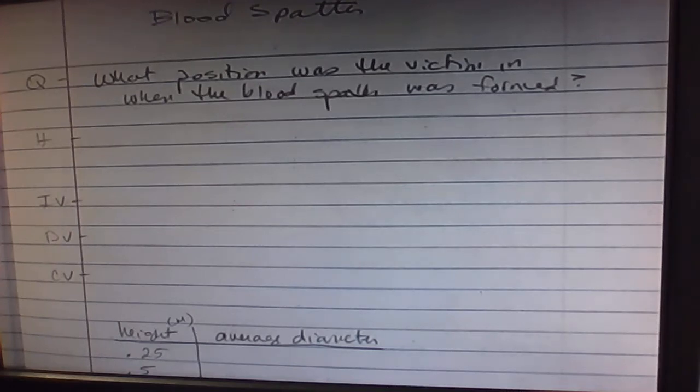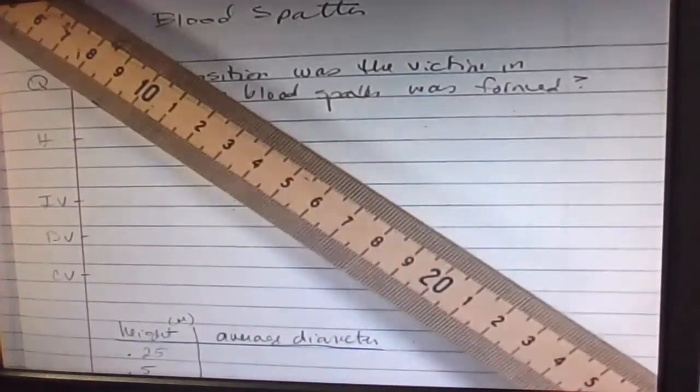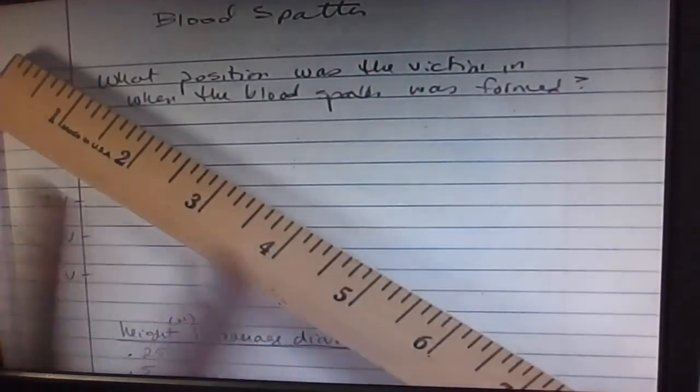It's been determined that the blood spatter on the folder came from the cut on Anna's head. Anna had a cut on her head. It created the pool that was on the floor, and it's determined that it also most likely created the spatter. So considering where she might have been, and that the cut was on her head, grab a meter stick, the side with the centimeters on it, not inches, because inches isn't going to correlate here.